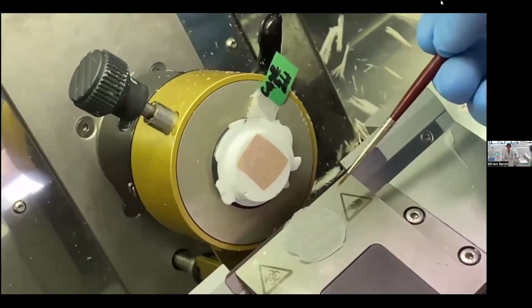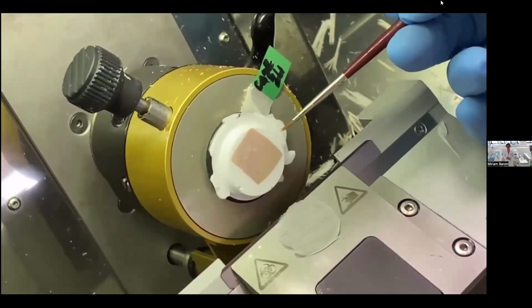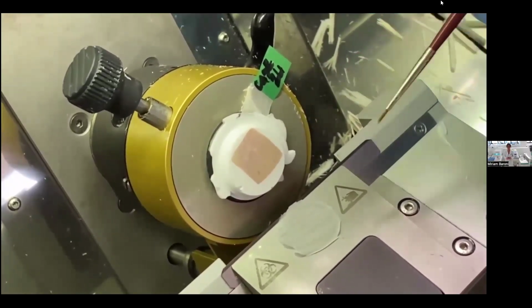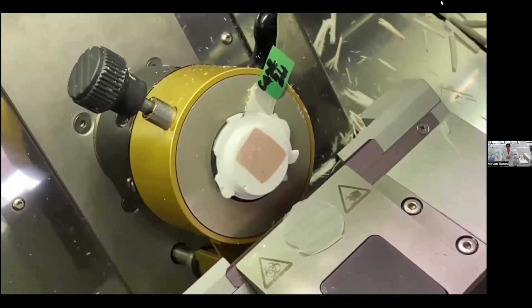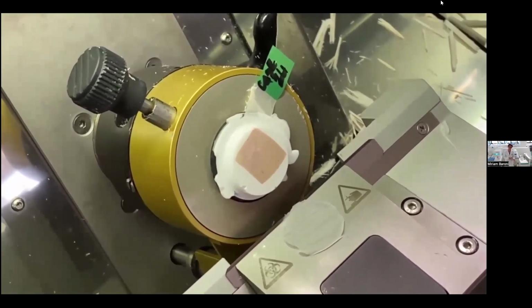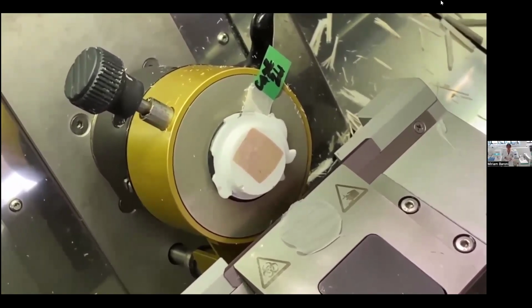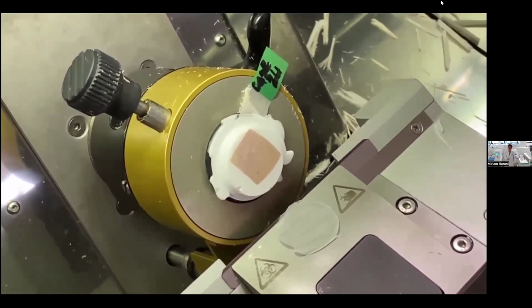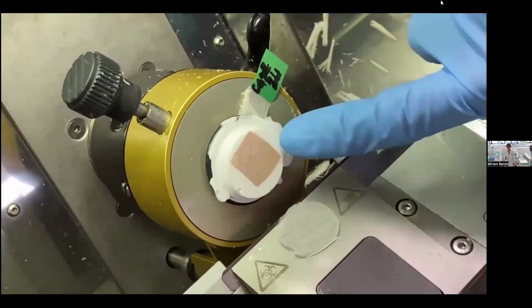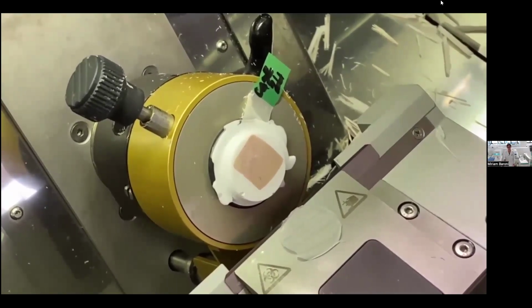In fact, if I needed to freeze a more delicate sample such as brain, which is better sectioned at minus 15, 16 degrees, I can reduce the freezing time in the PrestoChill to stop the cooling curve earlier and have a less cold block, but anyway of good quality. On the other hand, in the case of adipose tissue, I can increase the freezing time in the PrestoChill to obtain a very cold block, which allows me to cut also fatty tissue that normally in cryostat is a nightmare. So with the PrestoChill, I can control also the final temperature of the block.